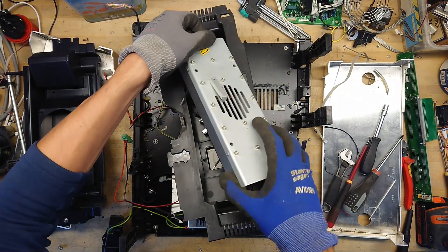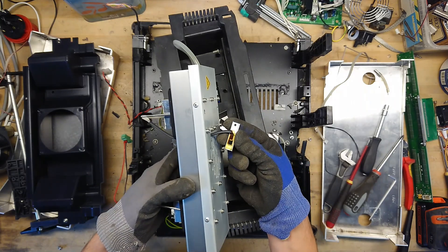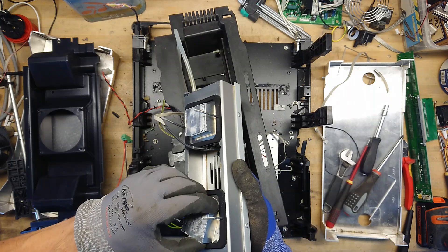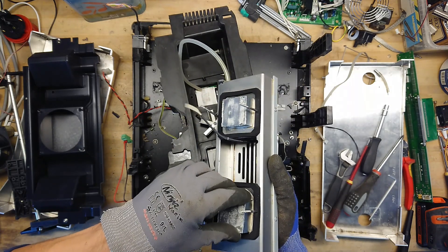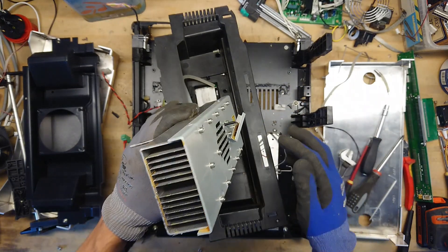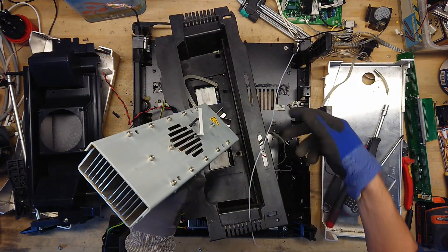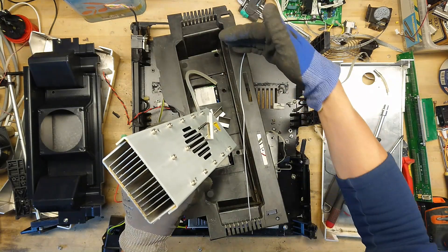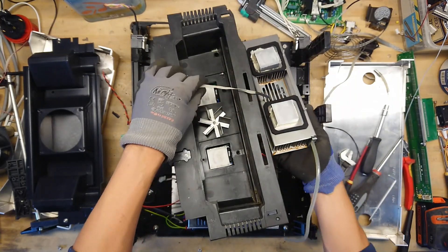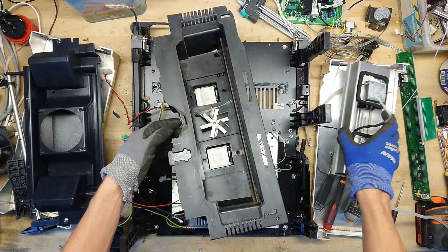And just like that, we can see there's some kind of temperature sensor sitting at the front. This is just two blocks of aluminum sitting at the whole front grill, which is actually the heat exchanger. Here you would have the circulating heated air going all around, and you'd have your hoses from your experiment — these small liquid lines going in and out — and you control the heating of the chamber temperature to heat your liquid up. So that was just the heat exchanger.